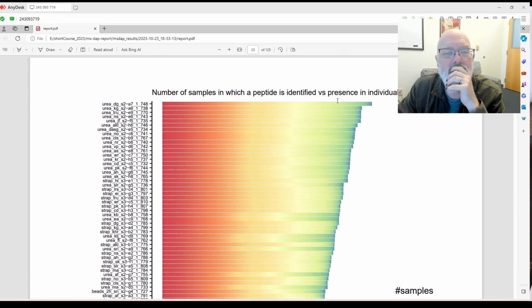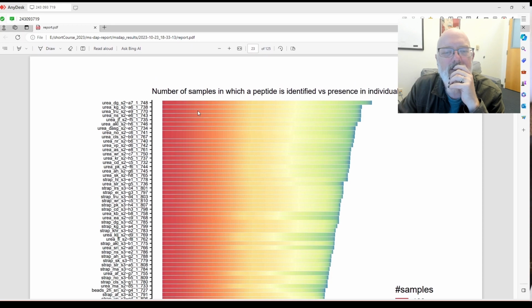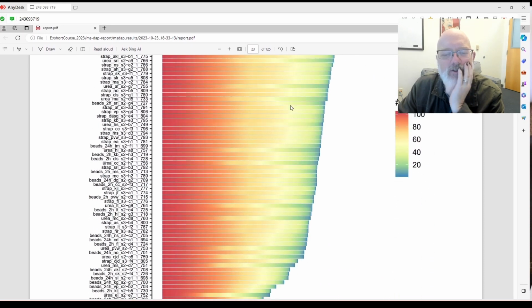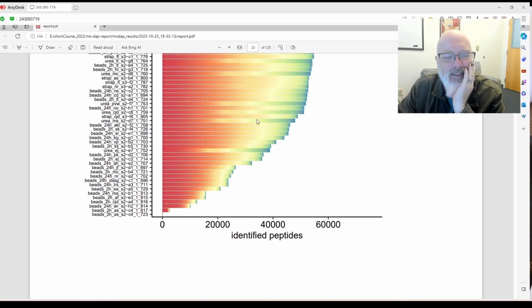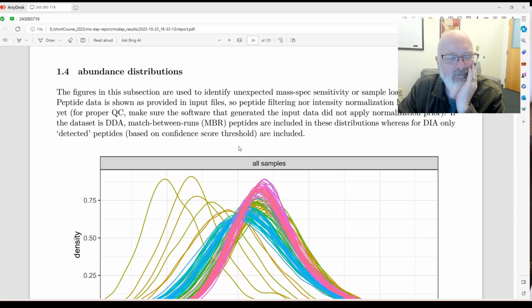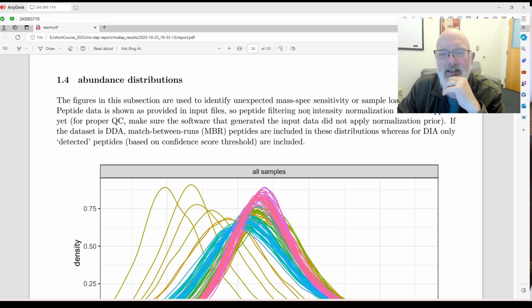Okay, that's kind of cool. So this one identified the most number of peptides, and this number of peptides were in 100% of the samples. It kind of shows you the number of peptides per sample and how unique those peptides were across all the samples, or in common. Okay, abundance distribution. This figure and the subsection are used to identify unexpected mass spec sensitivity or sample loading differences.